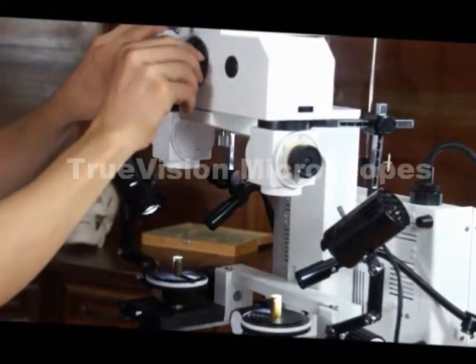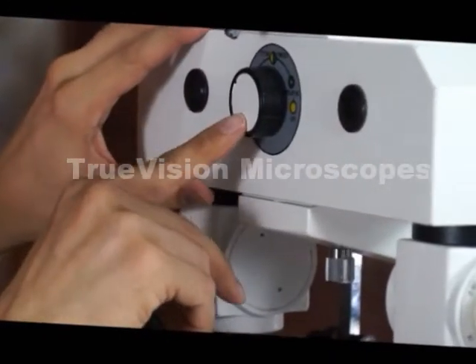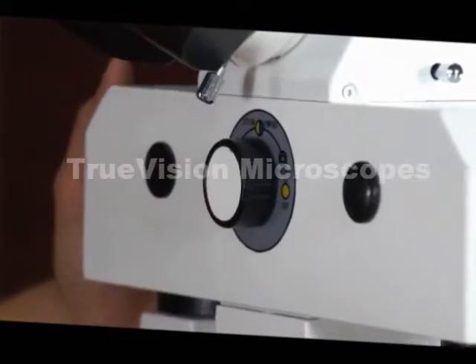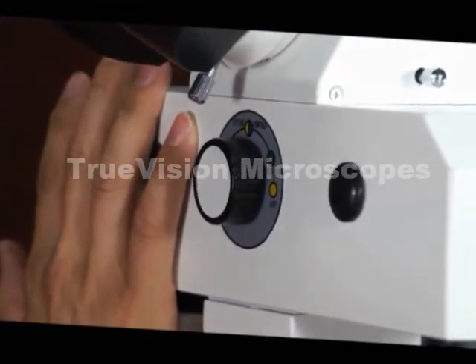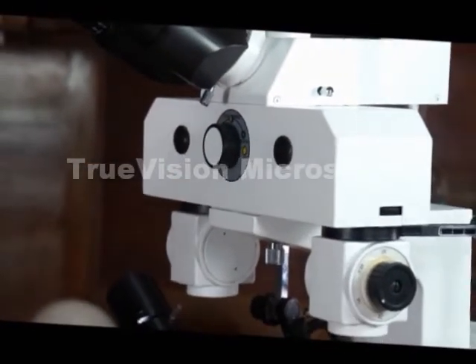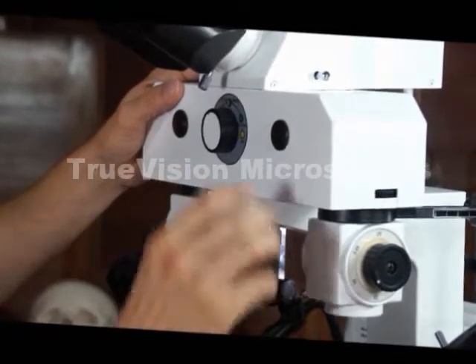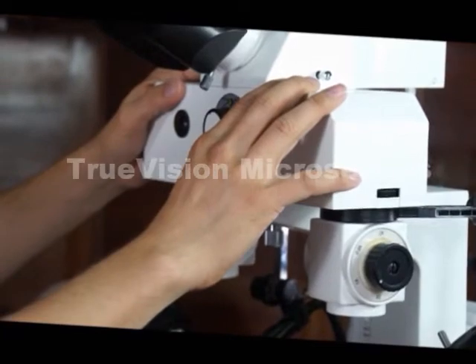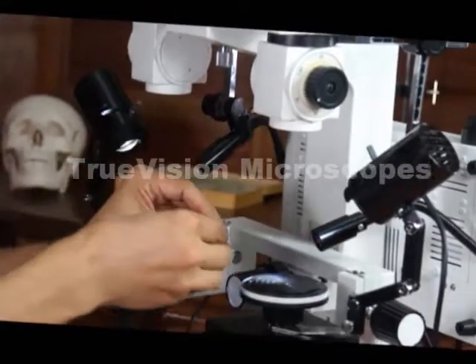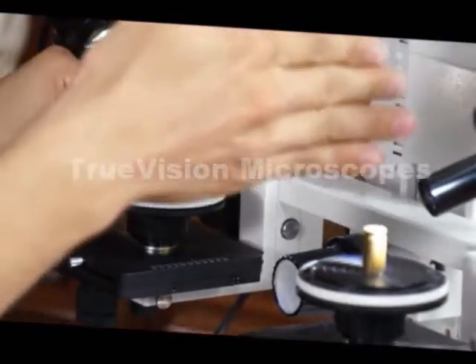At this point, we have the ability to change what we're looking at. We can turn the knob one direction and the whole image shows only this side, or turn it the other direction and the whole image shows only the other side. You can also have an overlapping where the image is cut. On that cut line, here we have a specimen — I have a bullet casing — so you could show half of one and half of the other.